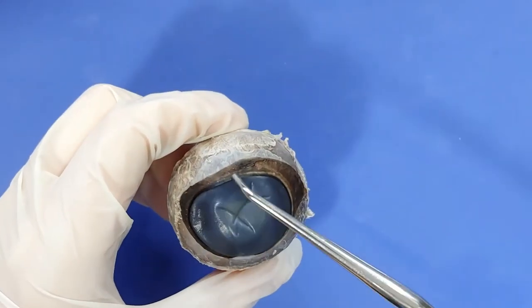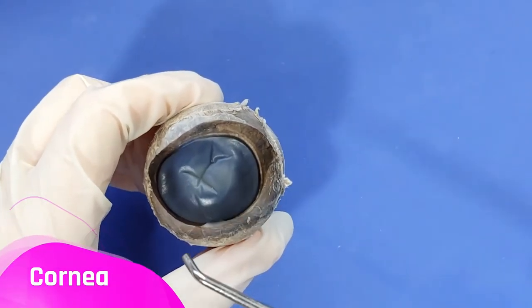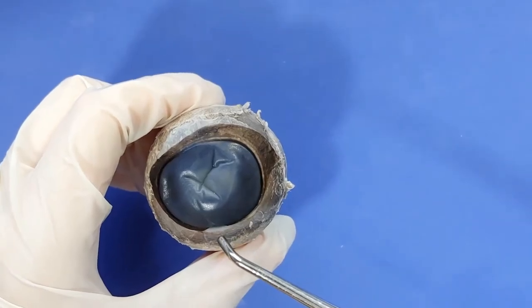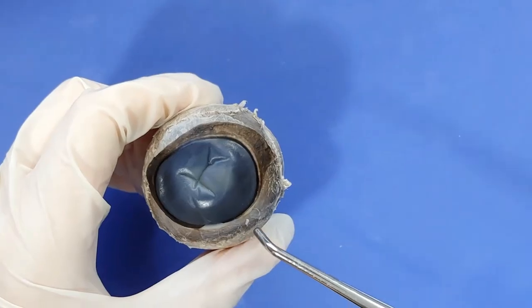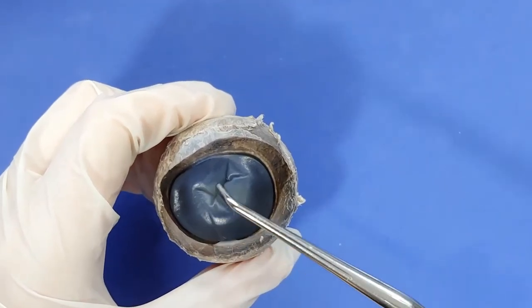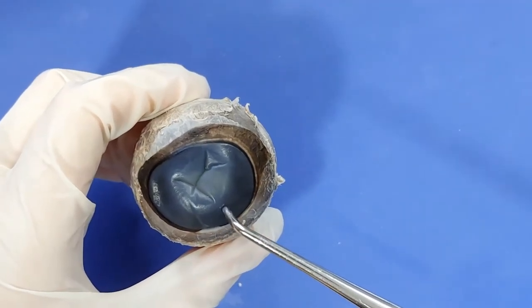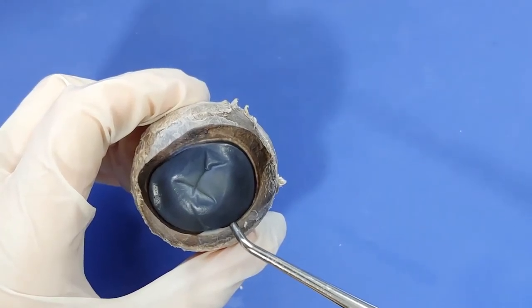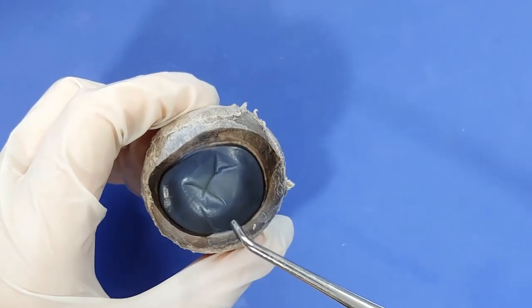This clear area at the front of the eye is called the cornea. Like the crystal on a watch or the windshield of a car, your cornea serves as a protective window that allows light to enter your eye and come to focus on the retina. The cornea must remain clear for you to have good vision. The preservative turns the cornea cloudy, so when it was alive the cornea was clear and it could probably see pretty well.